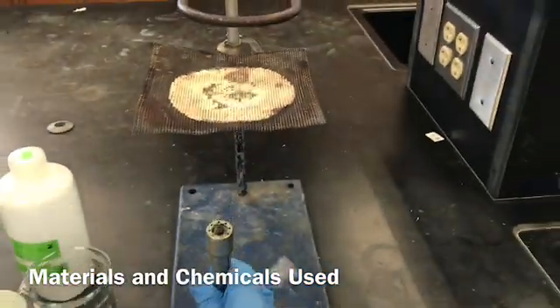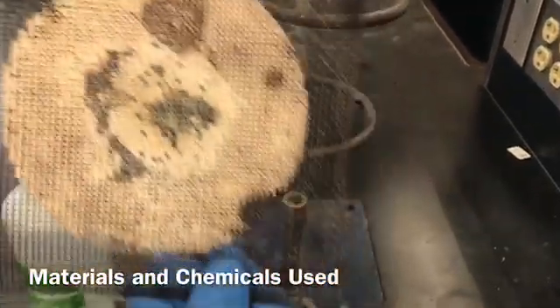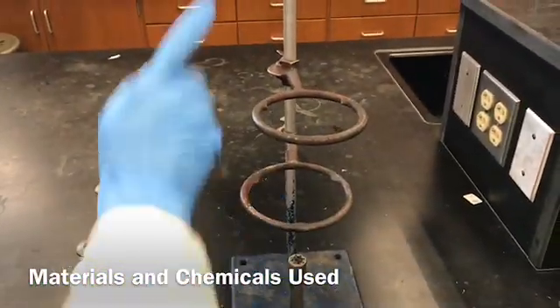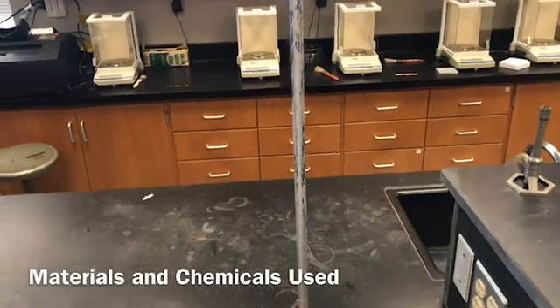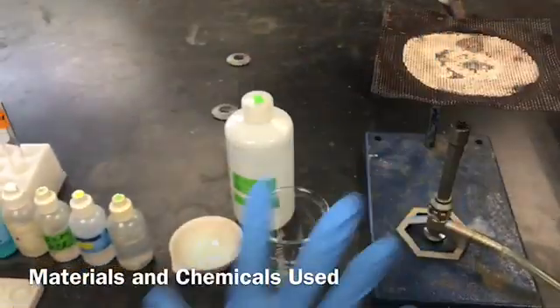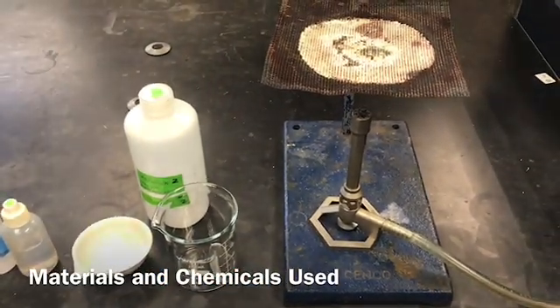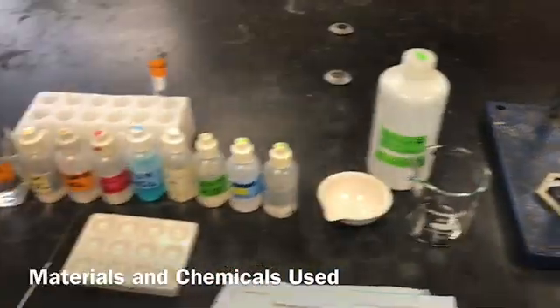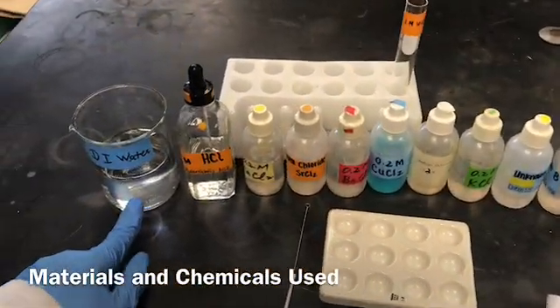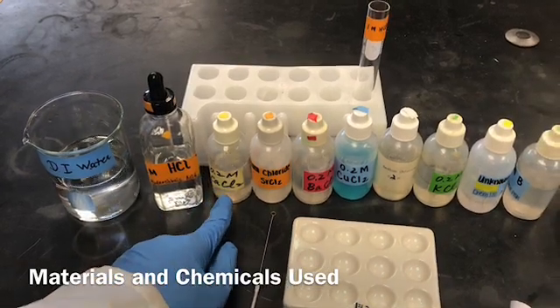These things are needed basically for the separation of a mixture. For the second part, the flame test, we need deionized water and 1 molar HCl.